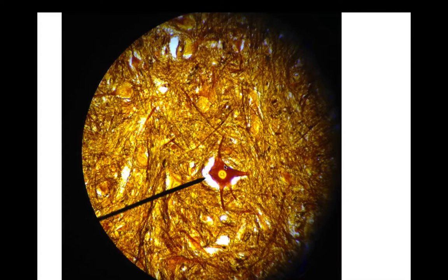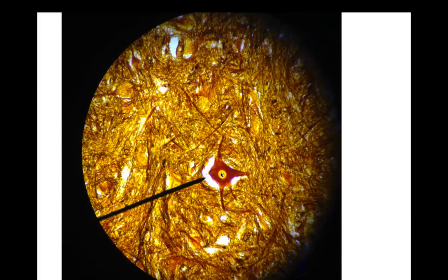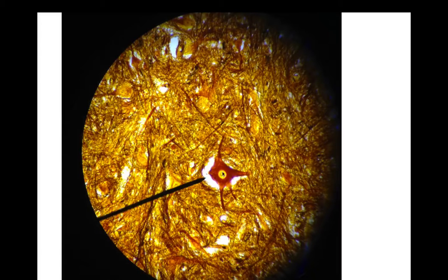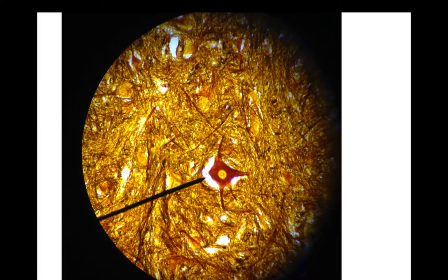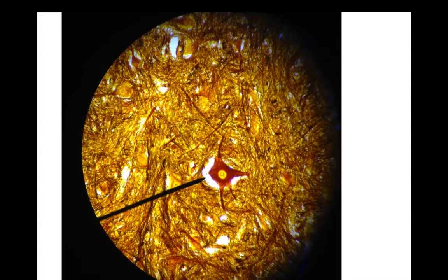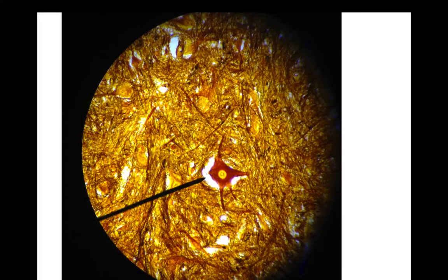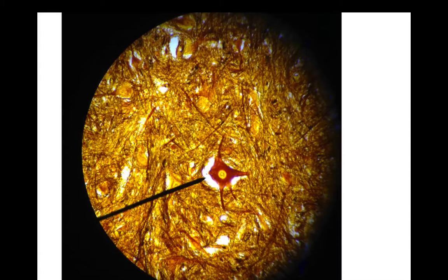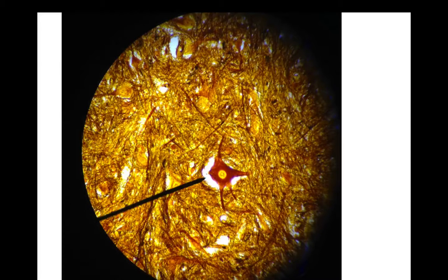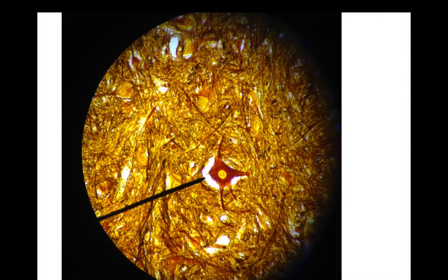Here's just a close-up of a somatic motor neuron in the anterior horn. Make sure you understand that the visceral motor neurons and the somatic motor neurons live in separate regions in the gray matter of the spinal cord — they keep separate, they are separate.